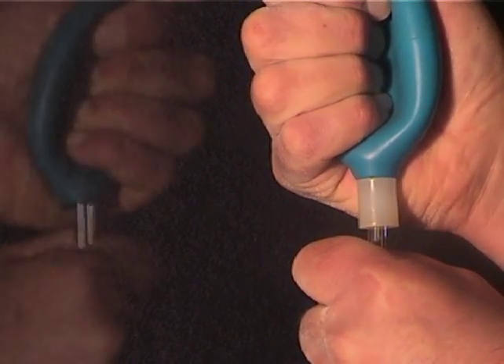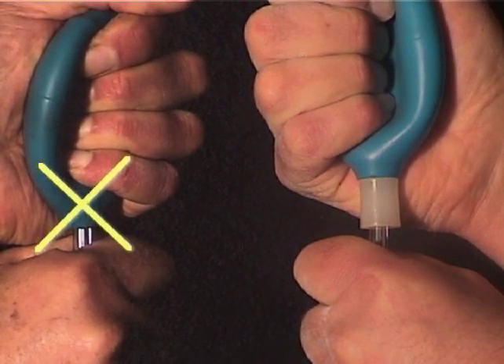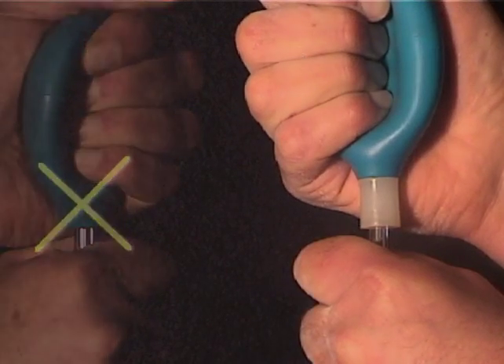Do NOT remove the plastic tip and insert the end of the pipette into the bulb. This common technique error is guaranteed to yield poor results.